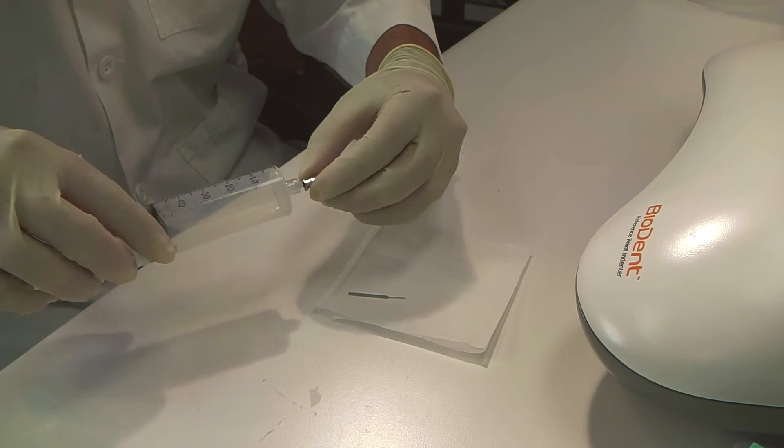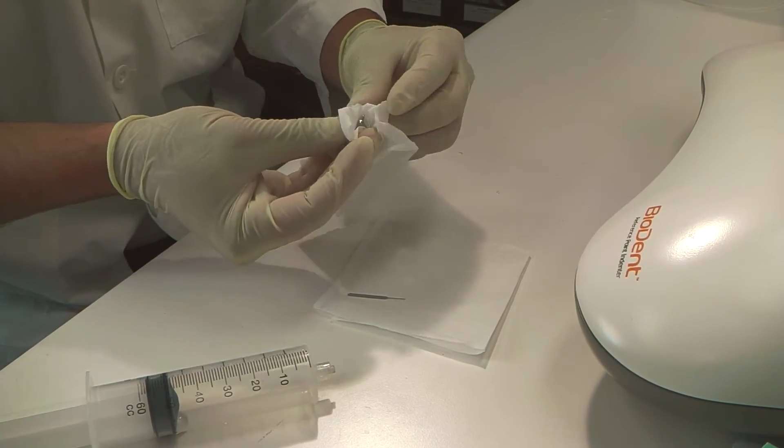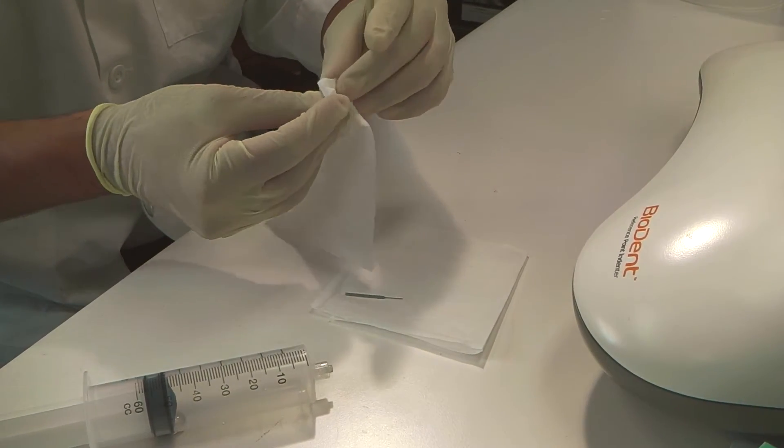Then take the reference probe off and wipe down any remaining solution. Place the reference probe in a safe location to dry.